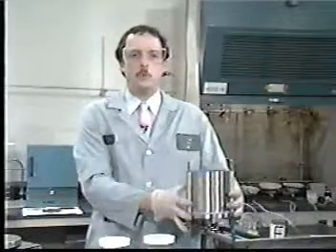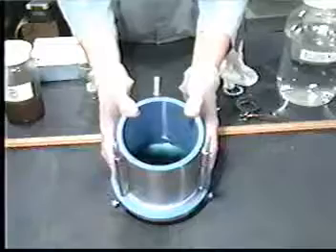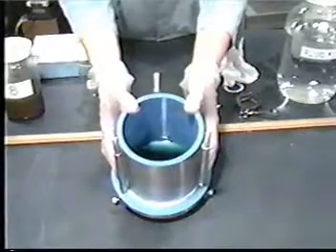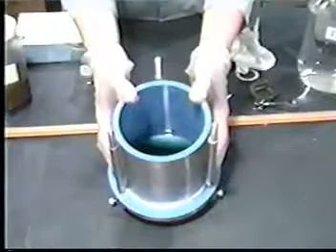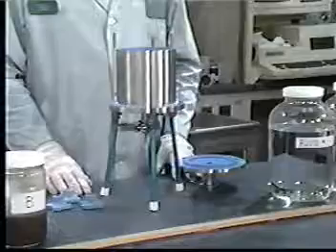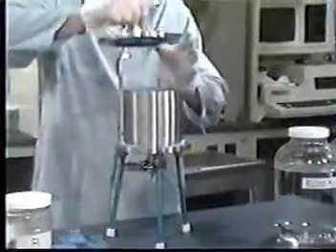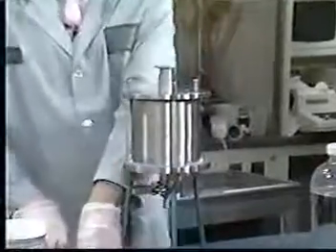Be sure that the waste completely covers the surface of the glass fiber filter within the device. If the filter is not completely covered, the pressurizing gas will pass through the filter unobstructed, with the result that solid-liquid separation will not occur. The top plate of the device is quickly put in place to prevent lateral leakage of the sample around the filter O-ring seal on the filtration unit.